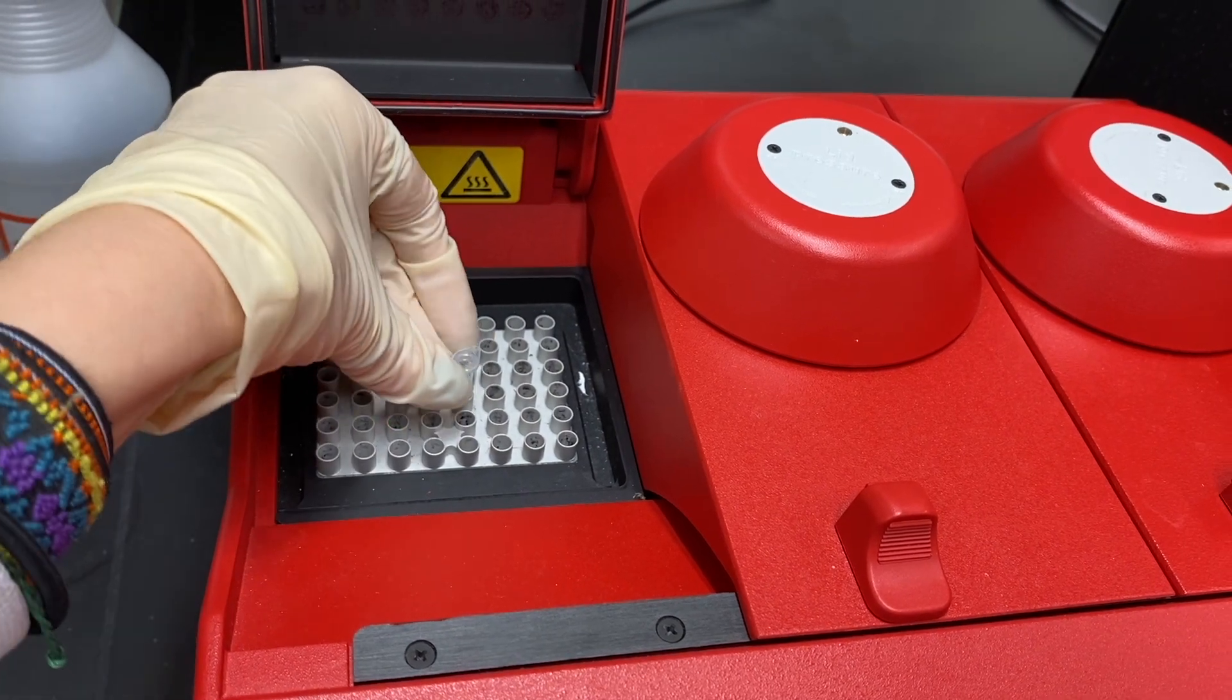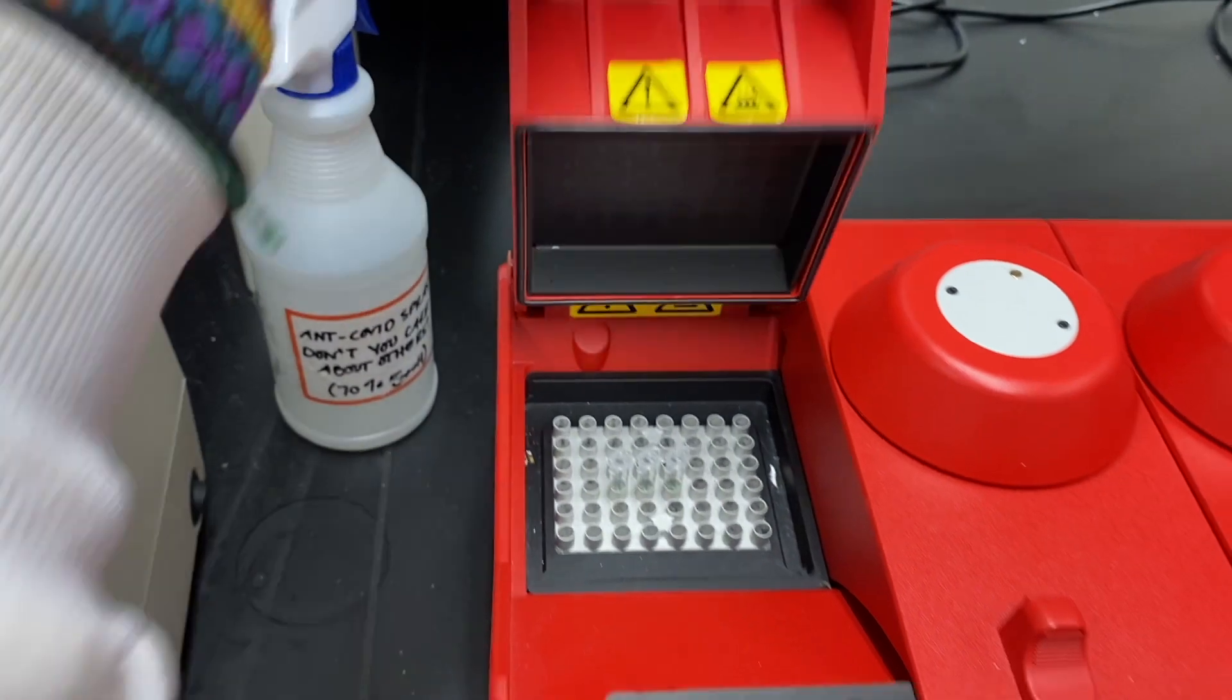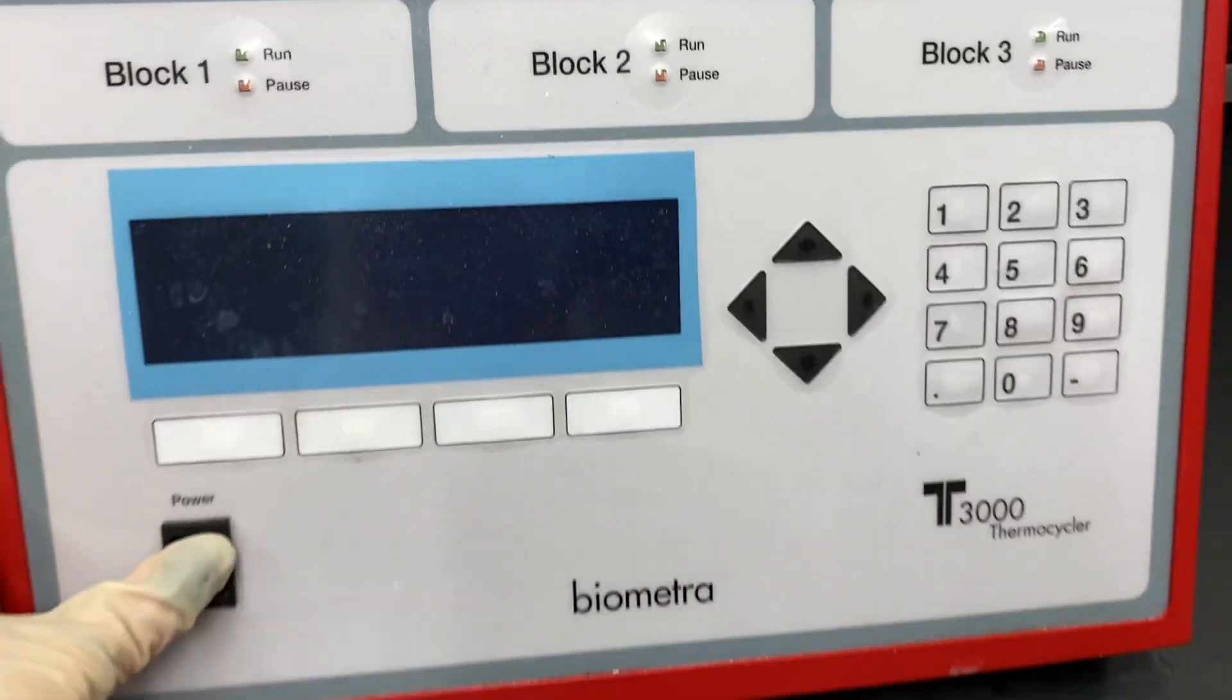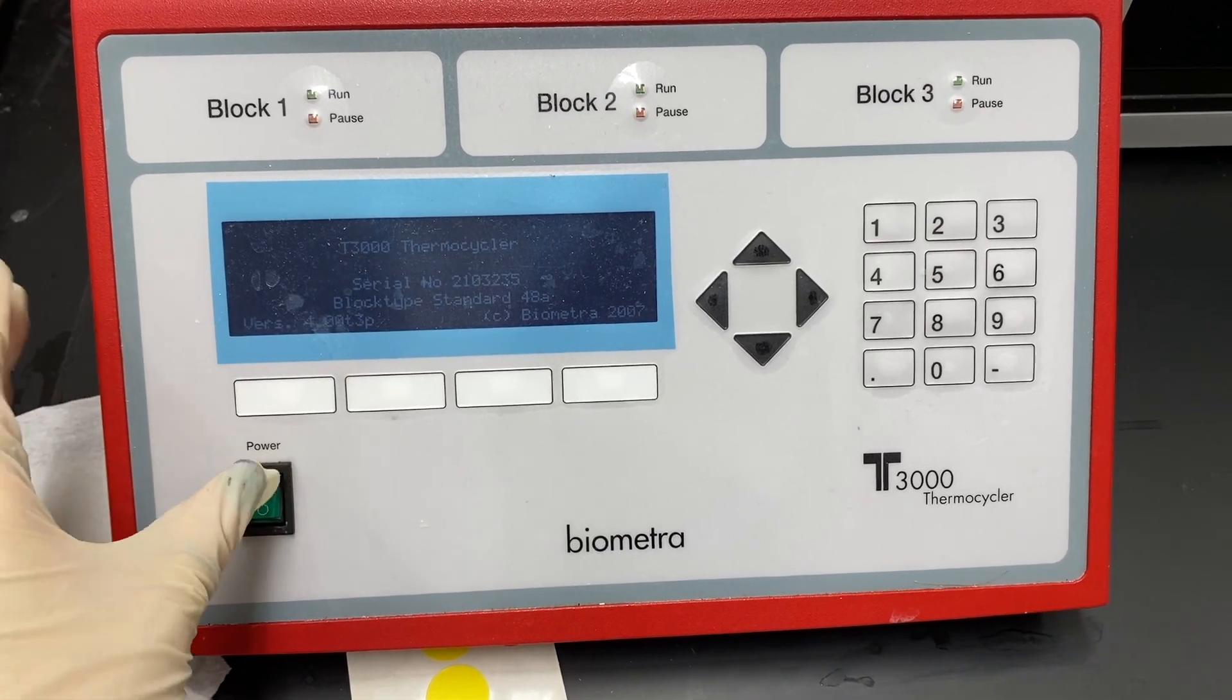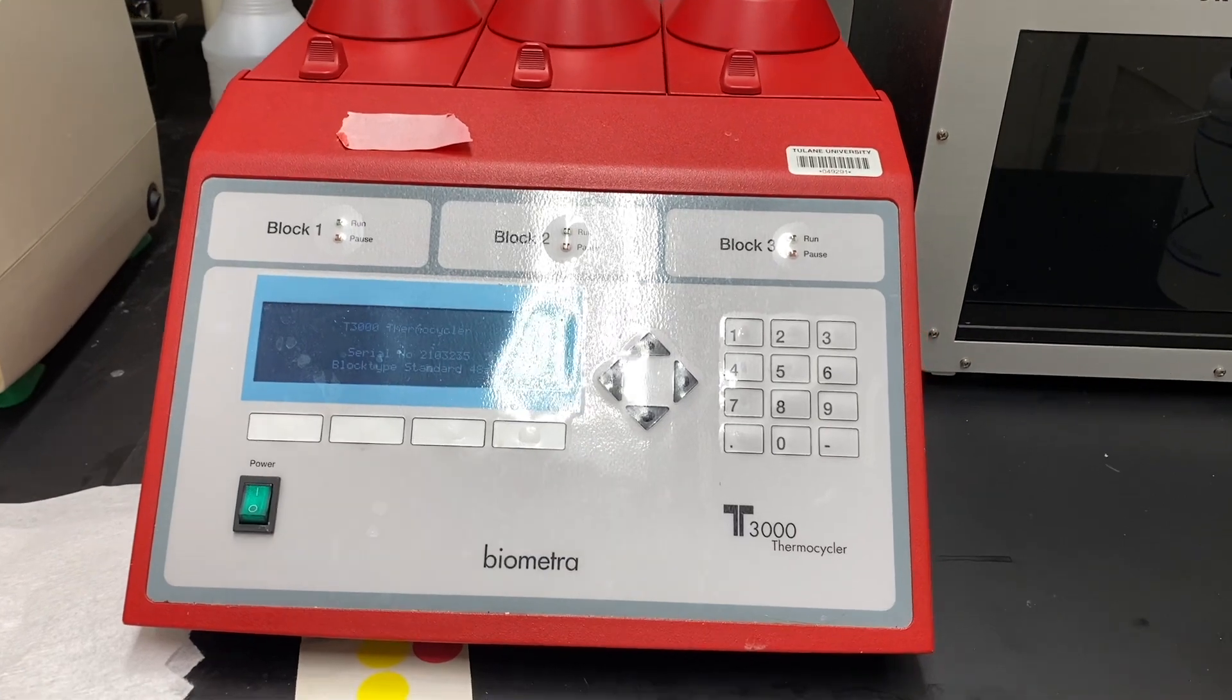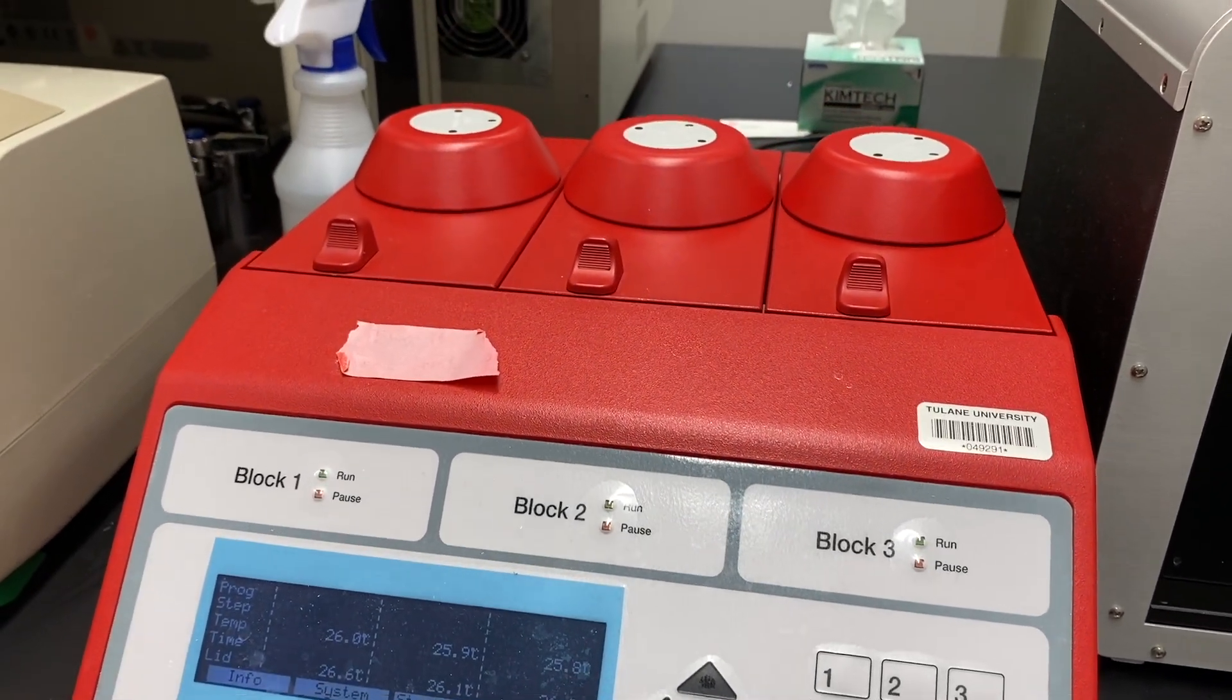This PCR, short for polymerase chain reaction, amplifies DNA by cycling through a series of different temperatures as pre-programmed by yours truly. I'm not going to go into detail about what's going on inside the PCR, because there are a lot of resources out there which animate the whole process better than I could explain it.